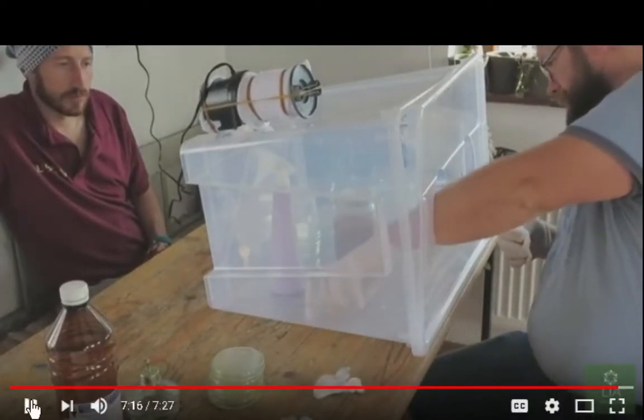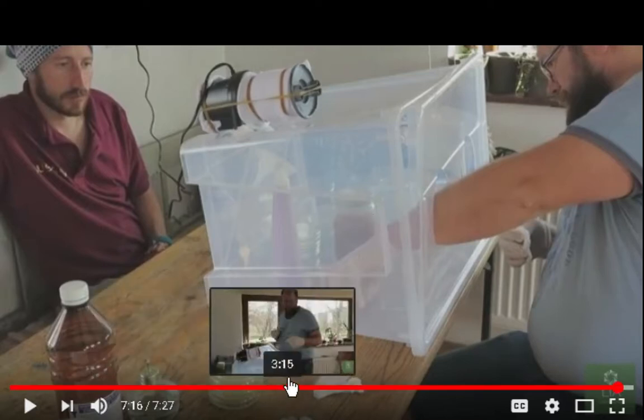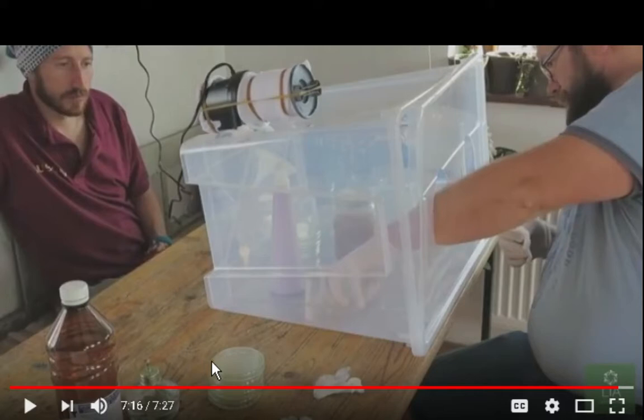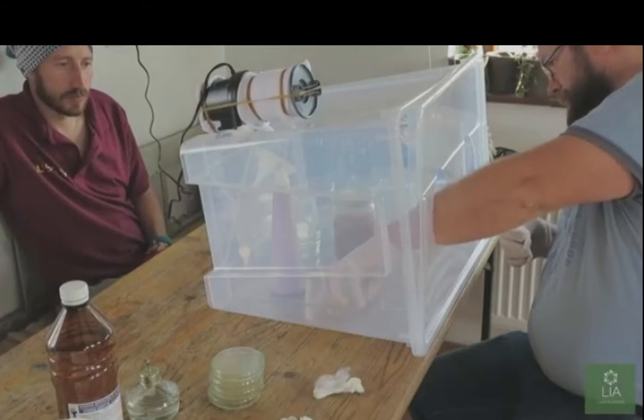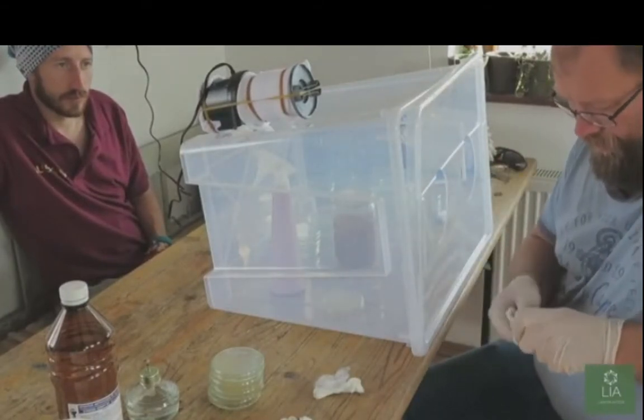Now, I don't understand, he said to let them cool. Well, I would let them, and then he's got a plastic dish here. I'm going to leave these dishes inside the container here, and also use a type of tape that you can put around the edge of the dish to seal it, because if you don't, then contaminants can get in that way. I mean, these spores are like micrometers small.